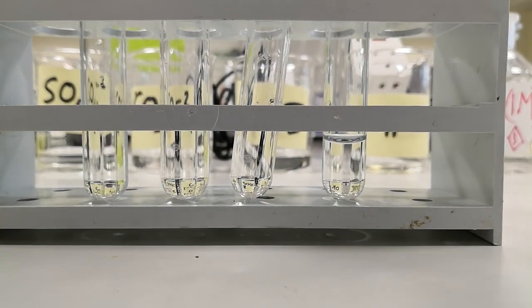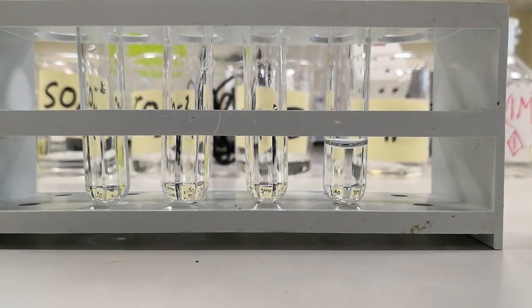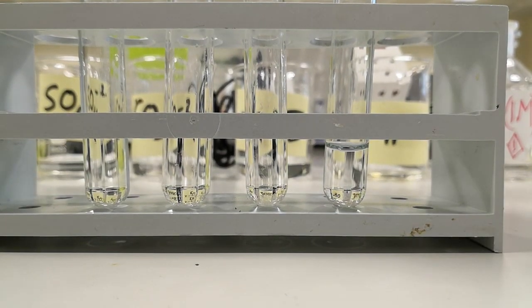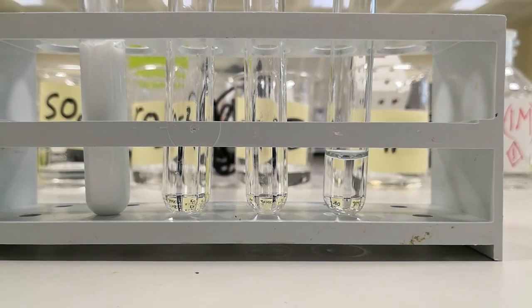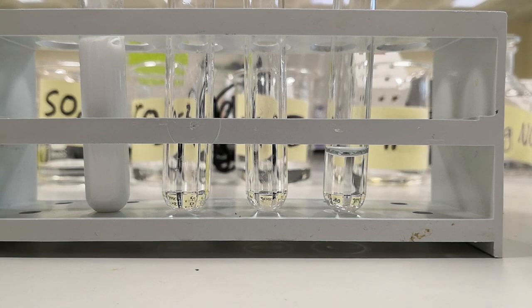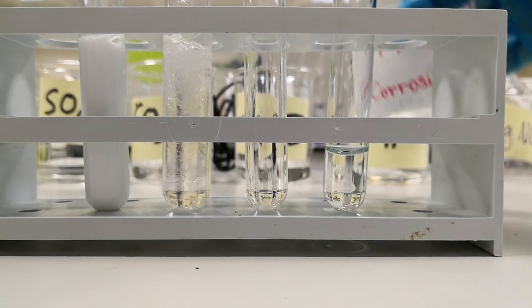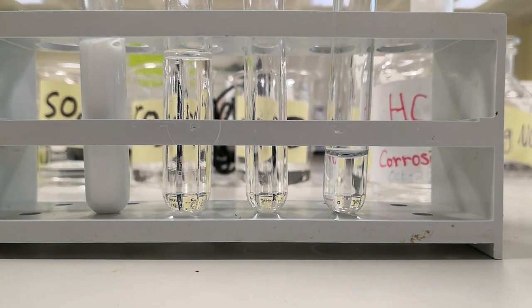In the next test tubes, we have a solution of sulfate, a solution of carbonate, a solution of acetate, and a solution of hydroxide ion. To the sulfate, we are going to add barium chloride — a white precipitate is observed. To the carbonate, we are going to add HCl, hydrochloric acid — you will see the formation of bubbles. And to this, we are going to add lime water that will turn milky.